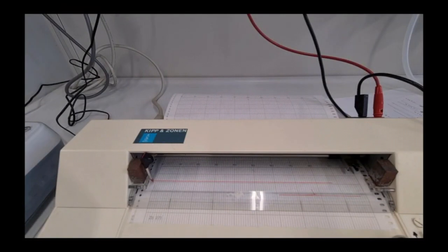Determine the freezing point of pure water both before and after the measurements of the solutions.